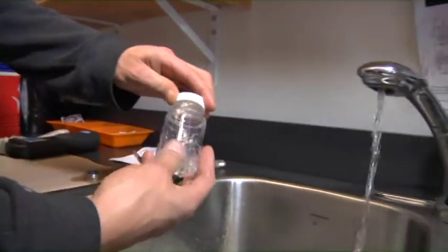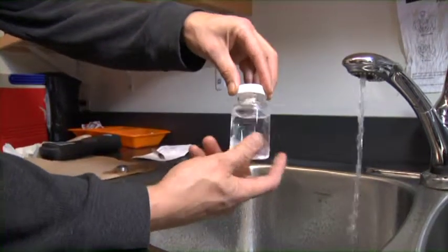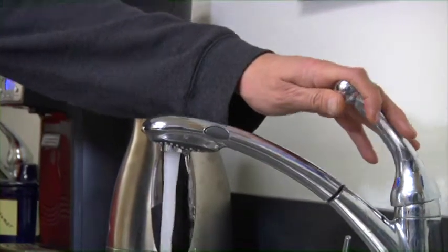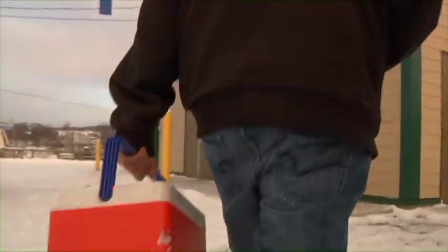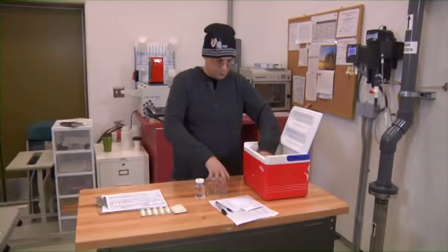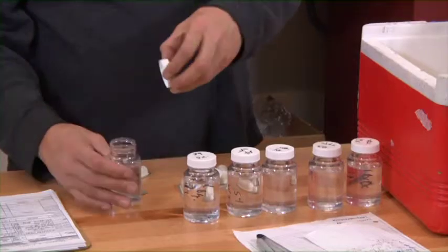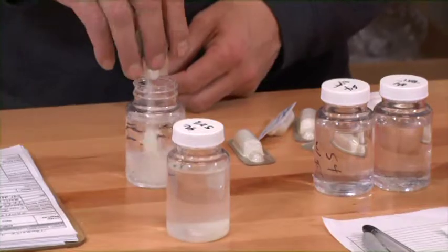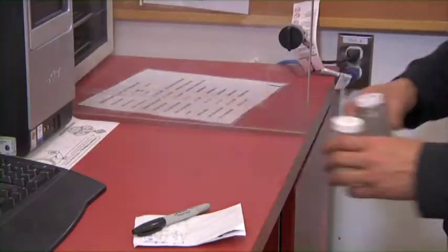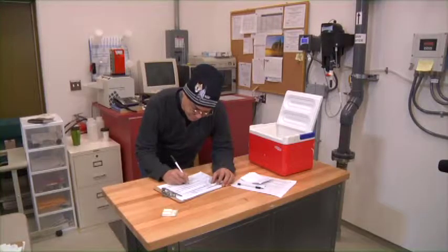Next, take the pre-labeled bacterial analysis sample bottle and fill it to the 100 mL line. Before leaving each location, be sure to replace the aerator back on the faucet. Once you have all six samples, return to the town site water plant. Add the bacterial analysis reagent to each of the samples collected. Then place them in the incubator, which should have a temperature of 35 degrees Celsius, for a period of 24 hours. Be sure to record all required data on the sampling record sheet.